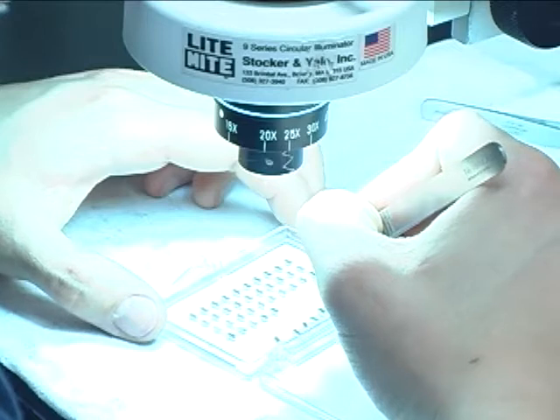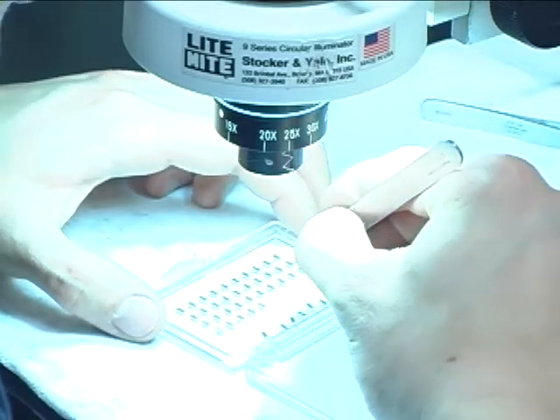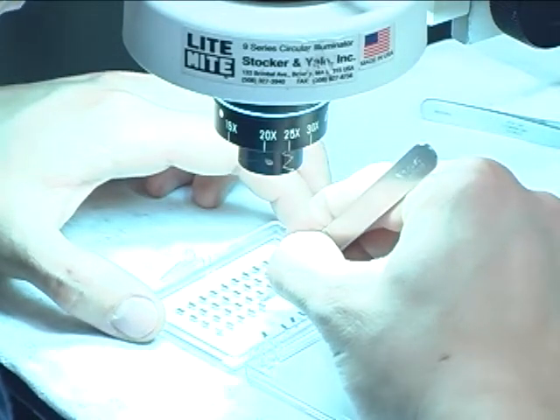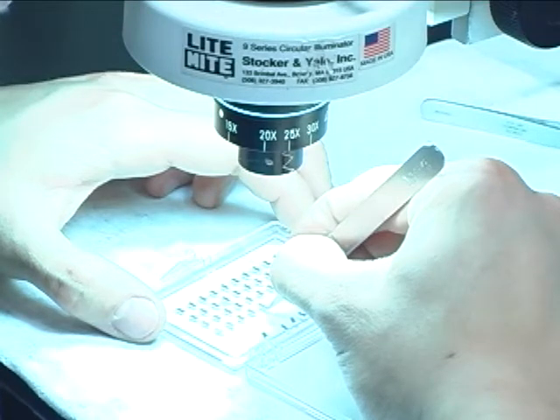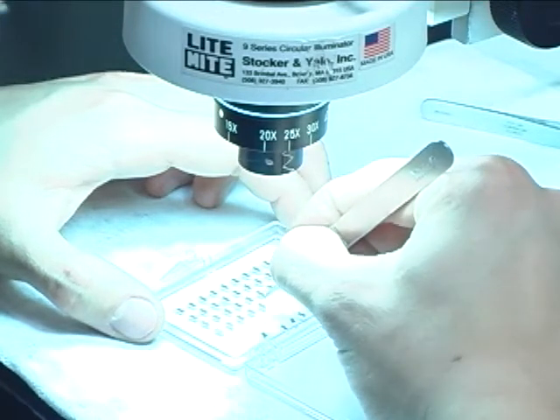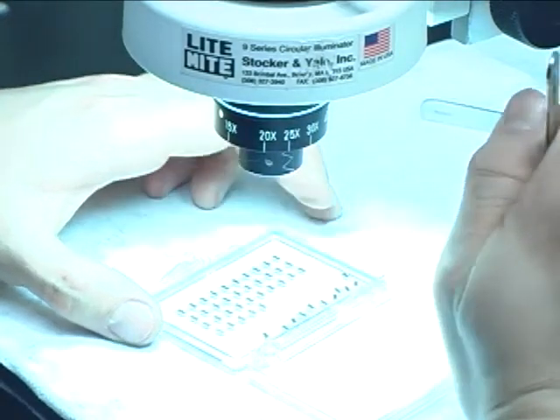All right, so we'll go in and we'll pick a chip and bring in our tweezers and use them to knock off two of the excess tips, leaving just one on the chip.